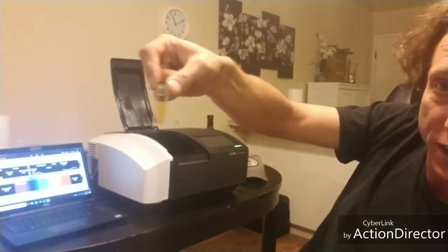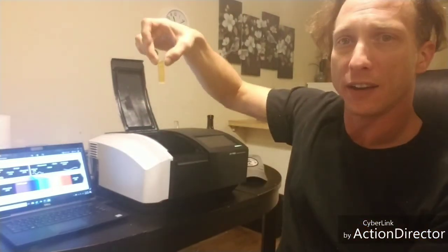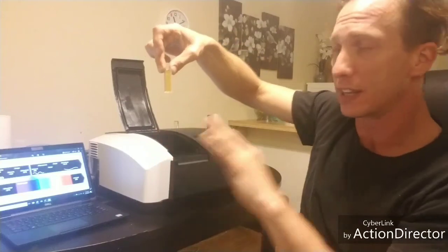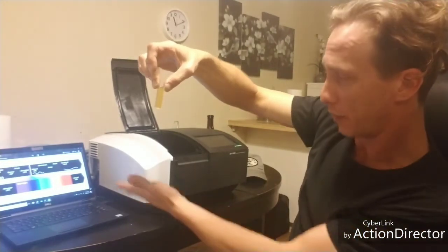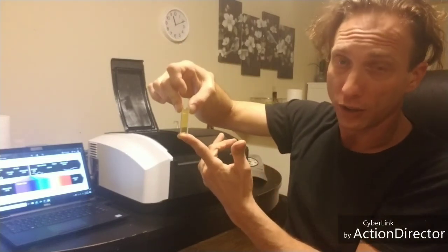Okay, so I poured a little bit of Sierra Nevada into this cuvette. You can see it has a little bit of yellow color. Now, the way an instrument like this works is it's basically just going to shine a light through this cuvette out the other side, and it's going to see what was absorbed. And you can look at this and you can see that it's definitely absorbing the light that's coming through, because you're seeing yellow, which means that it's basically going to be absorbing all of the wavelengths on the blue side, those kind of wavelengths, greens and things like that, to allow you to see this yellow color.